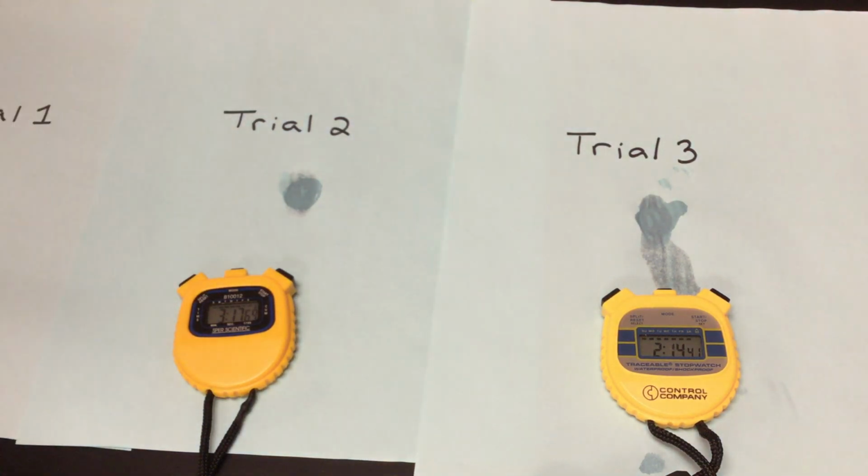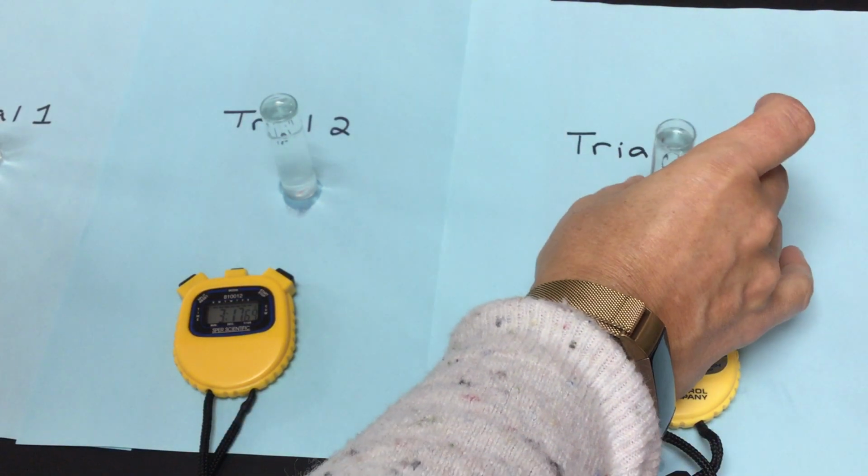So now we are on a pH of 7. pH of 7 is my neutral solution. Now remember, we have different pHs all throughout our body. So enzymes within our body, depending upon where they're located, are going to work in different pHs for us. So this particular pH of 7, let's see what we have here. So we have a hydrogen peroxide solution that is neutral in terms of our pH. And I'm filling these up all the way to the top. So we have those 3 full.